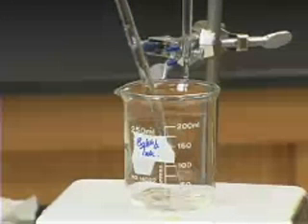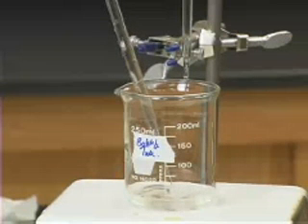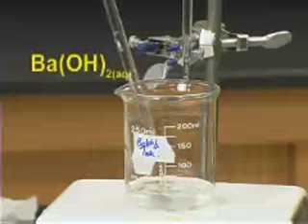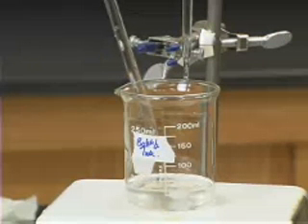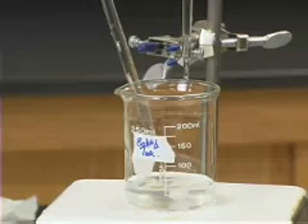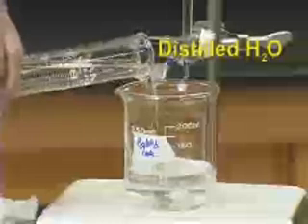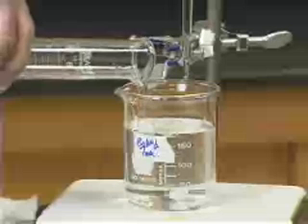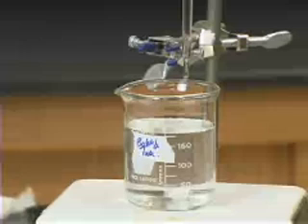We're now going to prepare our sample. We're going to pipette 50 milliliters of an unknown solution of barium hydroxide into the 250 milliliter beaker. We're going to add 120 milliliters of distilled water to the beaker. We're going to stir the mixture.